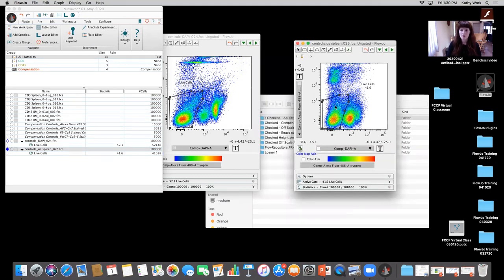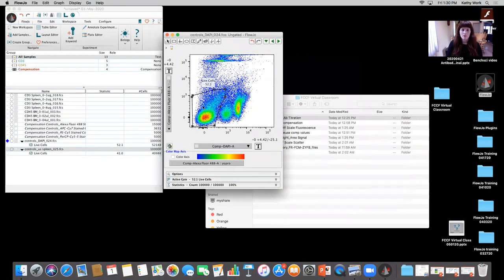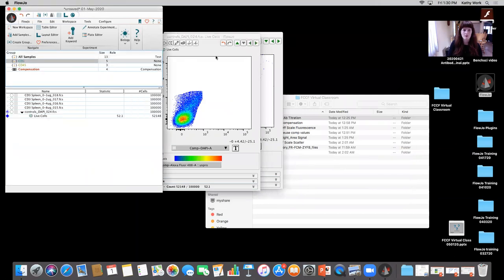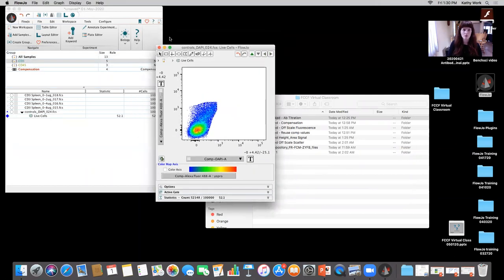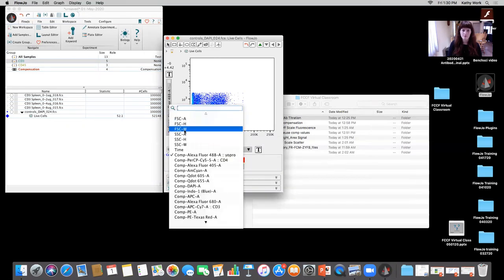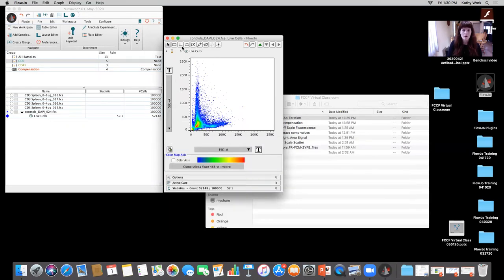Okay. So I'm assuming in this case, the unstained actually just meant that they went ahead and put in the viability and the apoptotic marker. Okay. So I'm going to open that up. And then from there, we go back to the CD3 group. What I want to look at is forward scatter versus side scatter. Okay. And this is a little bit of a tough prep.